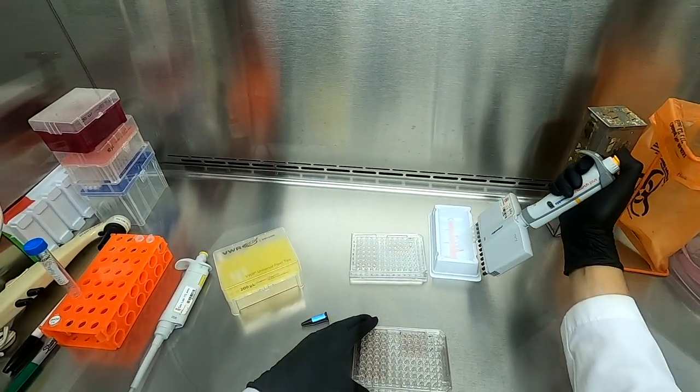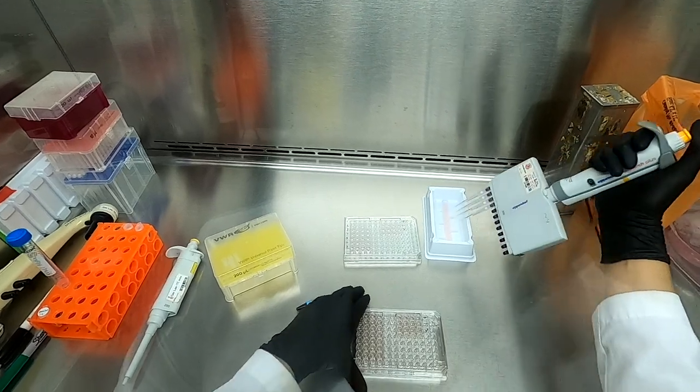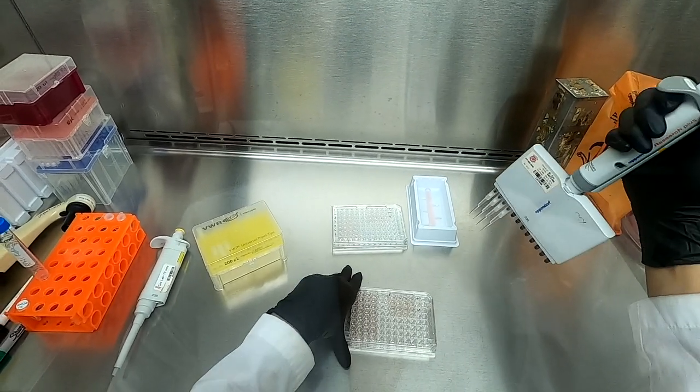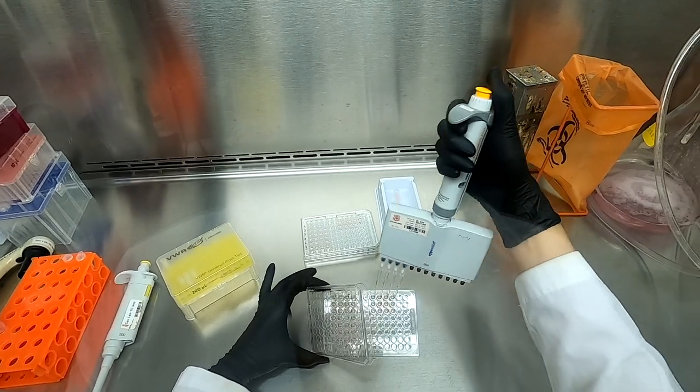Next, we will be adding our negative control. The negative control is simply complete media, so we will be getting it from the same reservoir.